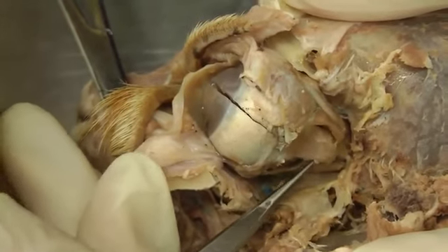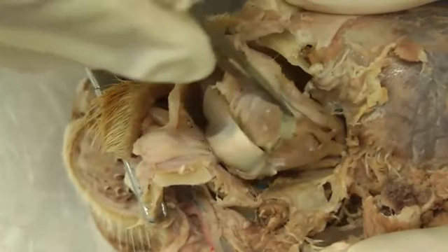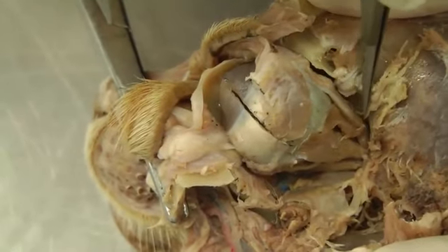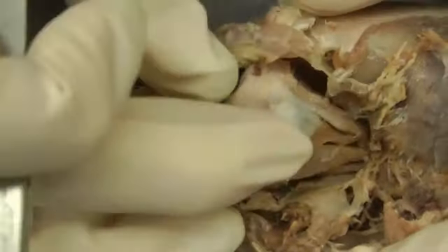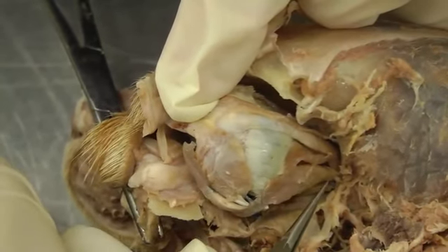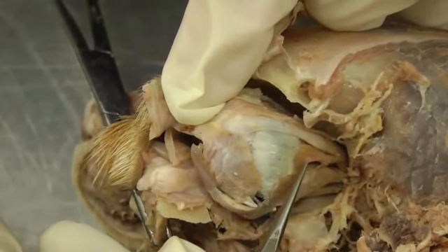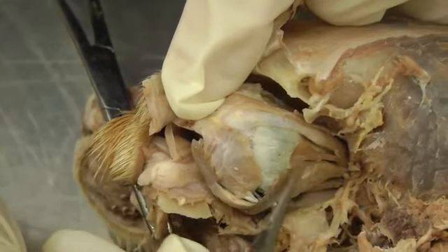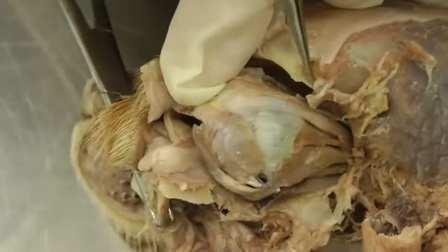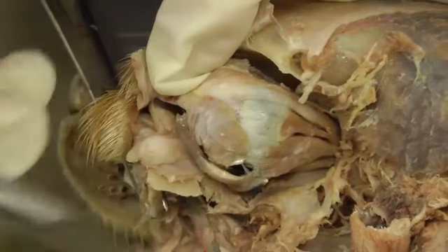All right, so we're going to start again with the rectus muscles. So here on the lateral side, we have a lateral rectus muscle. And then on the dorsal side, we have a dorsal rectus muscle. So that would be right here. I'll try and pull the eyeball out just a little bit. So dorsal rectus would be here. Lateral rectus is here. And then in between you have one of those fascicles of the retractor bulbi muscle. So the retractor bulbi is one muscle but has 4 fascicles, and they're in the spaces between the rectus muscles. So dorsal rectus, one of the fascicles of the retractor bulbi, lateral rectus.